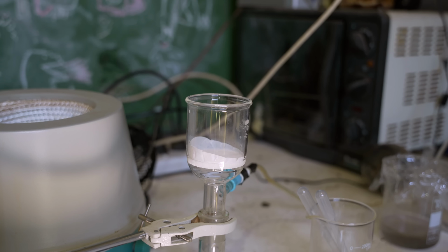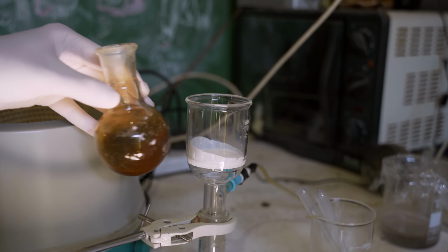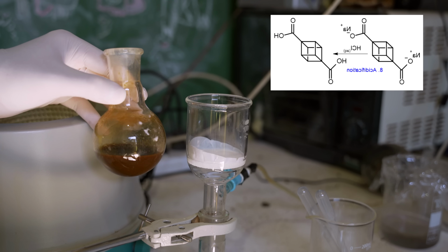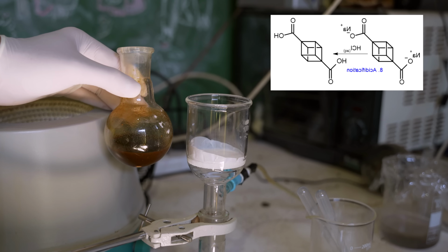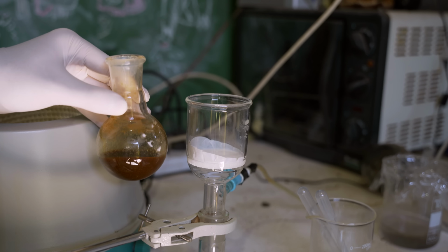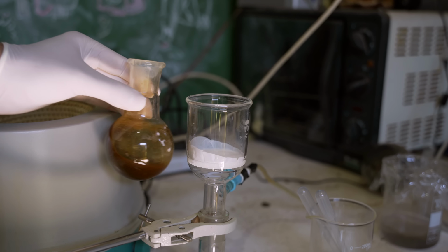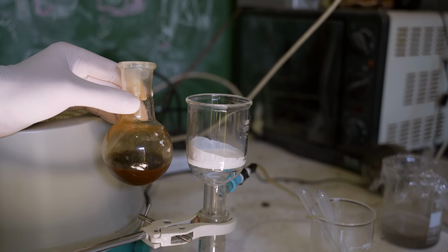All right, I've decided I wouldn't be fooled by the tar a second time. So I've readjusted the pH of this with some sodium hydroxide solution, so now it's on the basic side. So all the cubane dicarboxylic acid would react with the sodium hydroxide to form the sodium salt, which is much more soluble. So all the precipitate we see is benzophenone, the stuff we don't want. So we can now filter all that off, and then we can reacidify the solution. Stuff probably won't precipitate out that much, but we can then do an extraction with ethyl acetate, which we know works, to get the rest of the cubane out that will be free of benzophenone.